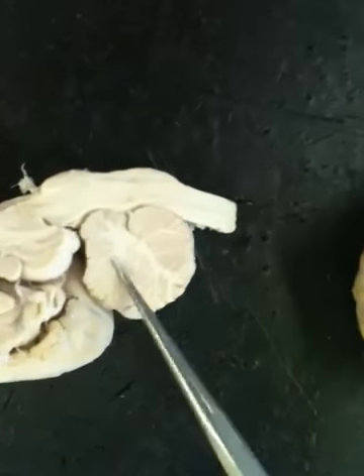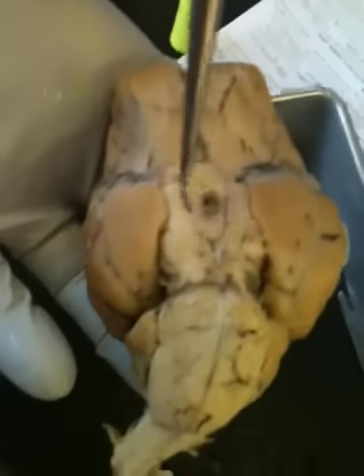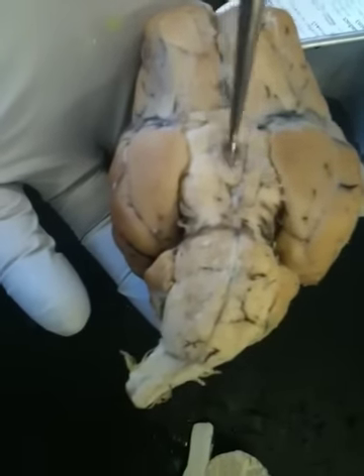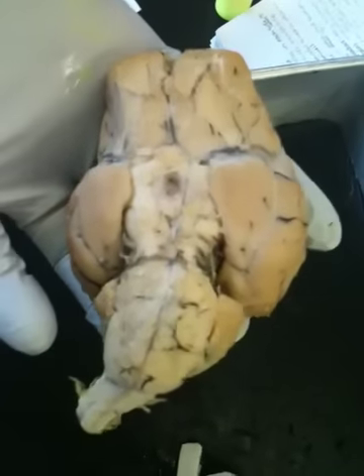Sorry, show it again. My hand was in the way. Okay, there we go. The tree of life, arbor vitae. The brainstem, starting with the cerebral peduncles. They're the two feet that are right next to the mammillary body and where the pituitary gland would be. So those are the peduncles right there, also known as little feet.